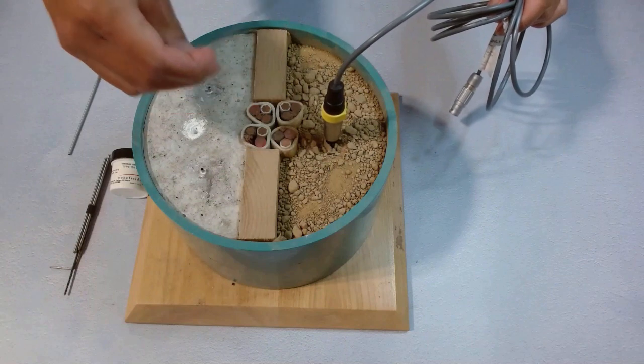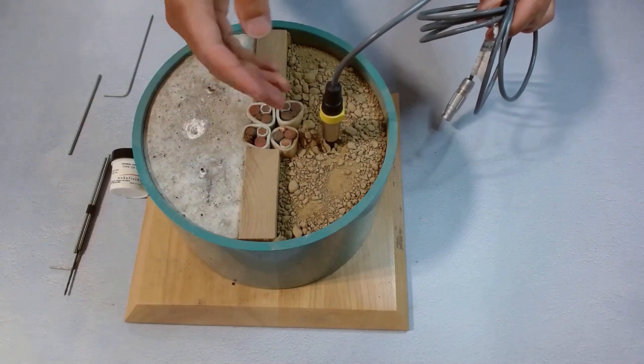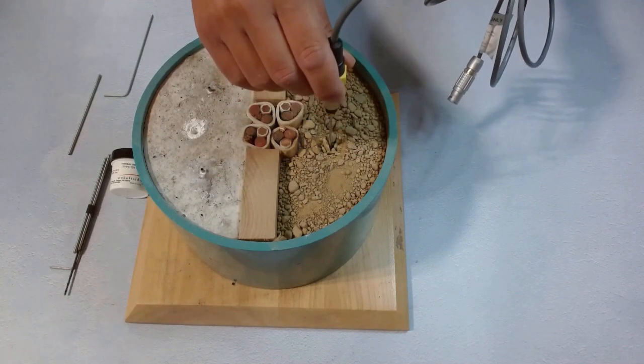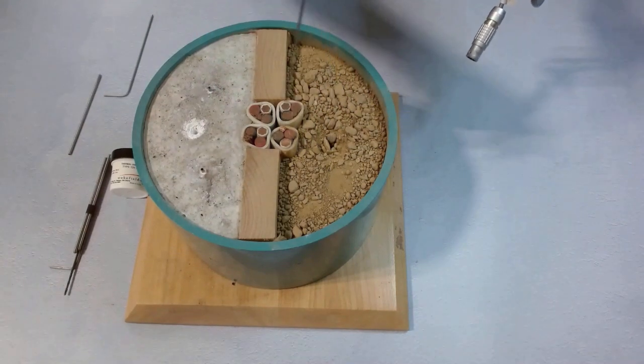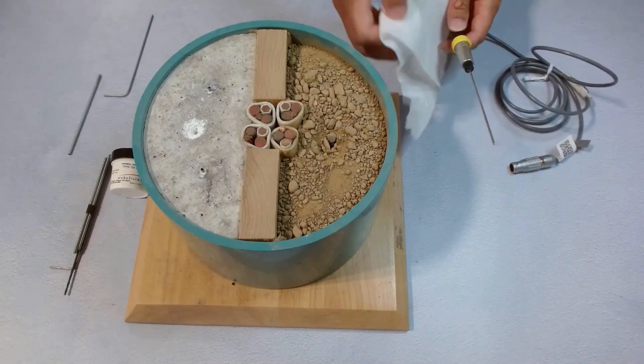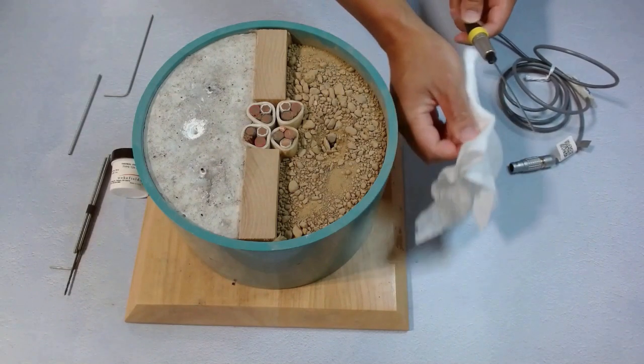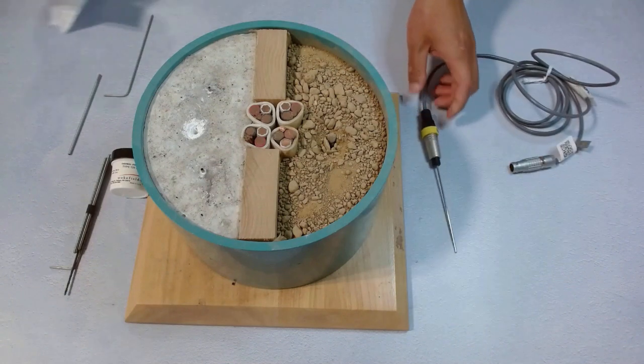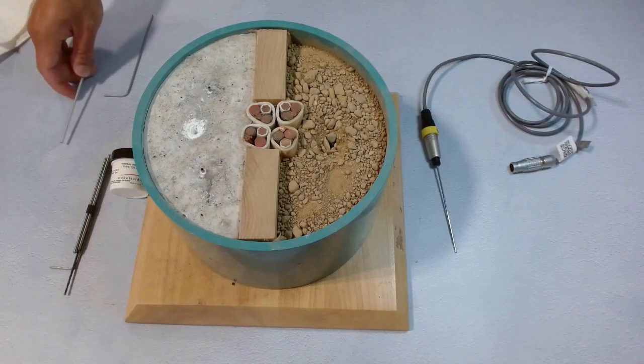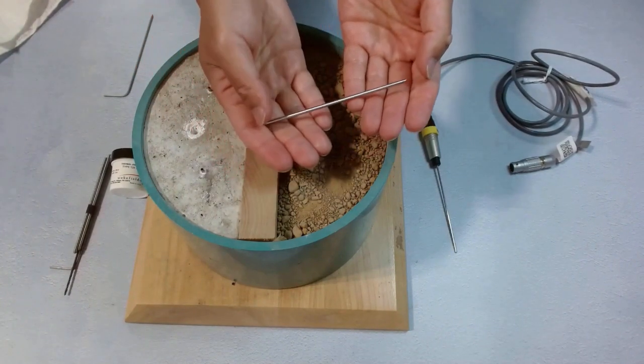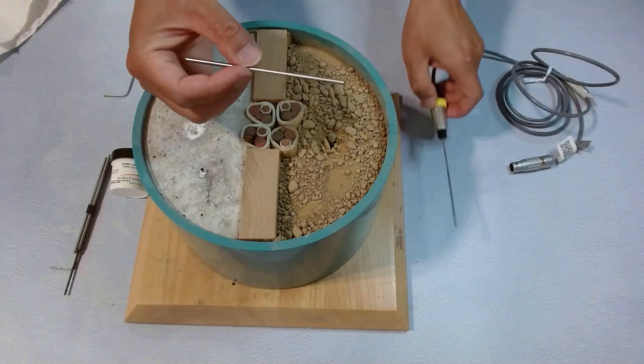Sometimes the dirt or some small rock would still go back into the hole, and the TLS100 needle is still hard to push in there. So we take the needle out gently, wipe it clean. We don't force it through when there's still a problem in case it gets bent or breaks. In that case, we will need this needle sleeve.